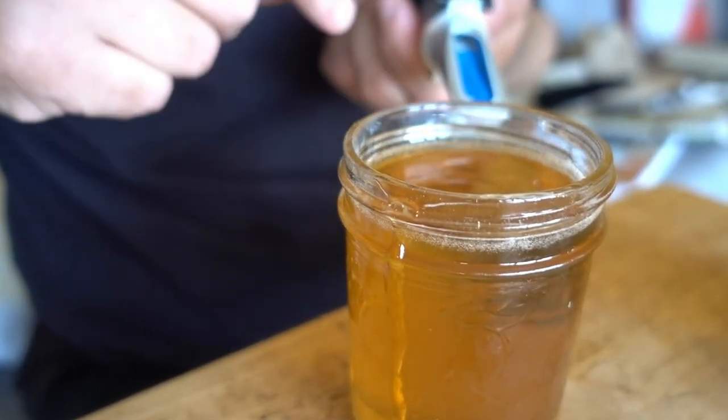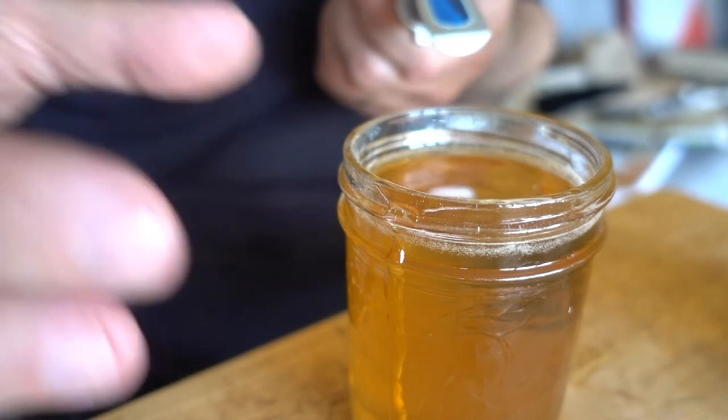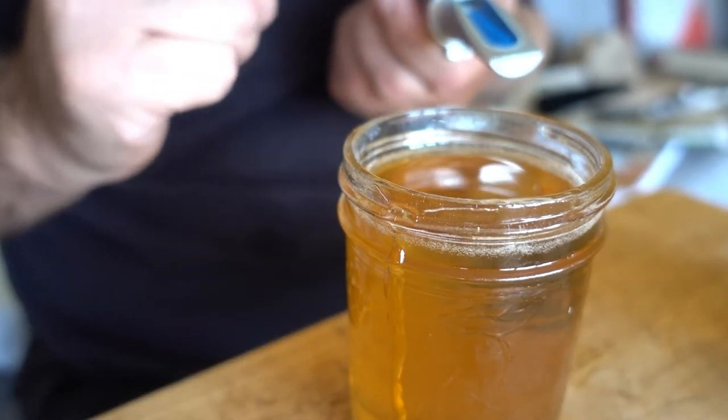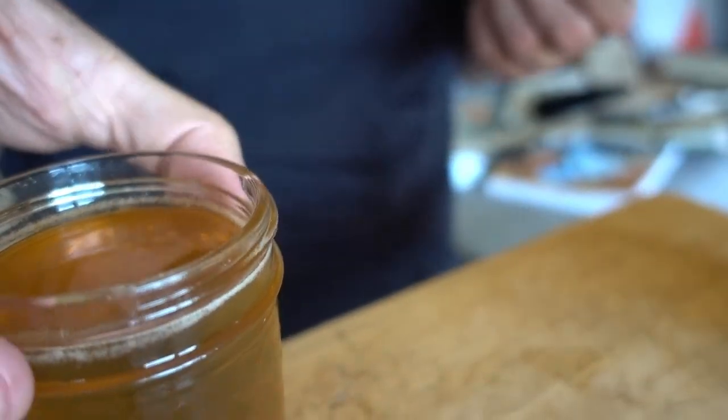I know that this honey definitely wasn't fully cured, even when I was extracting it I could see some nectar floating around and all that jazz and it's only one percent more water content than my fully cured honey so pretty good.